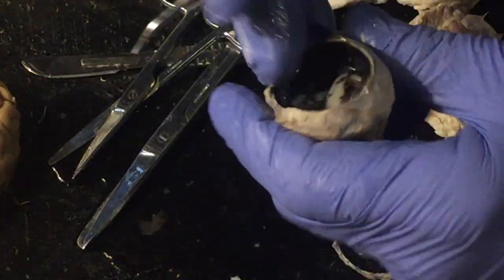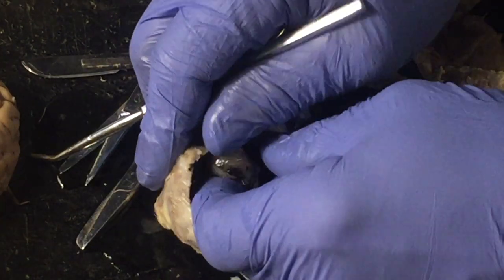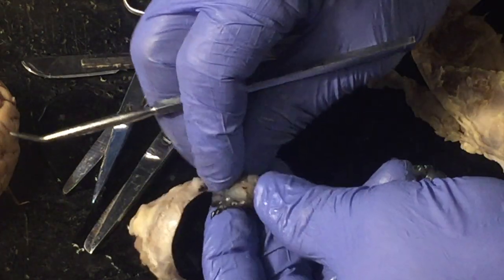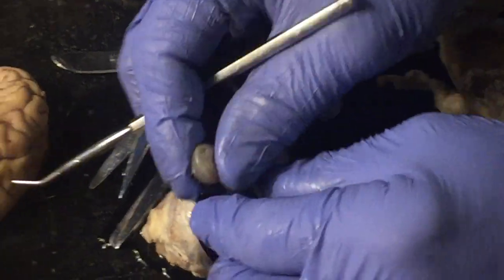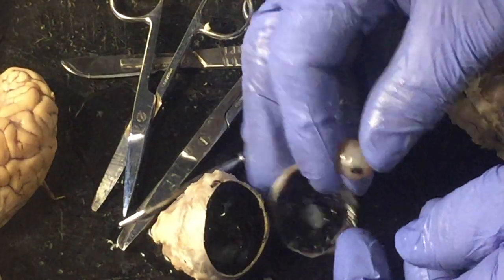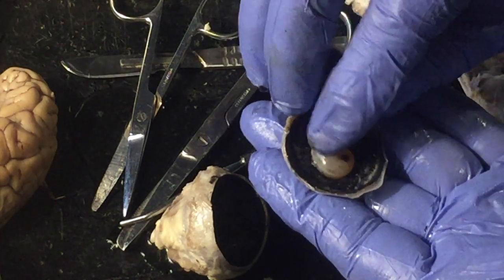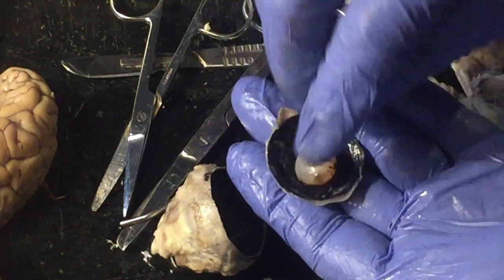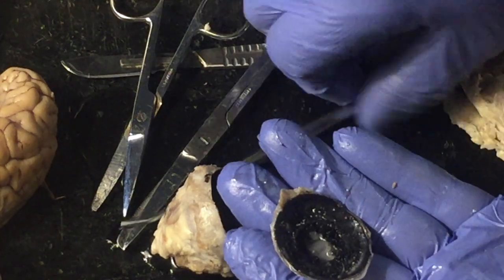Sitting right, see if I can pop this rascal out. Okay, right here, I'm just going to take this out. This has been clouded by the preservative that we use to preserve this. What I've just taken out is the lens of the eye. And this lens of the eye would sit like that, right there in that nice rounded little depression. Okay, right like that. And I'll take it out of the way.